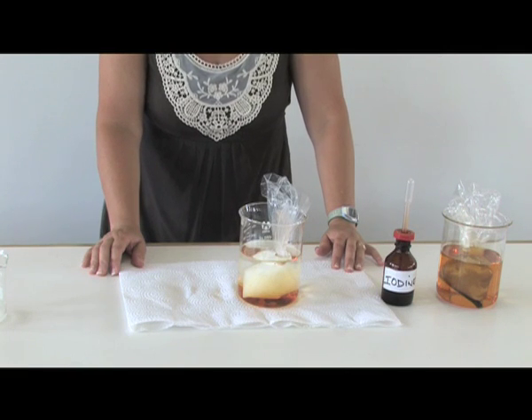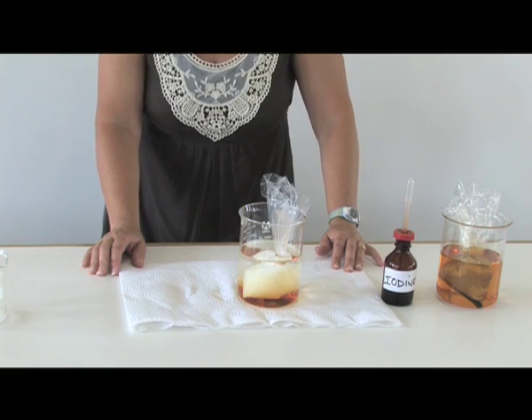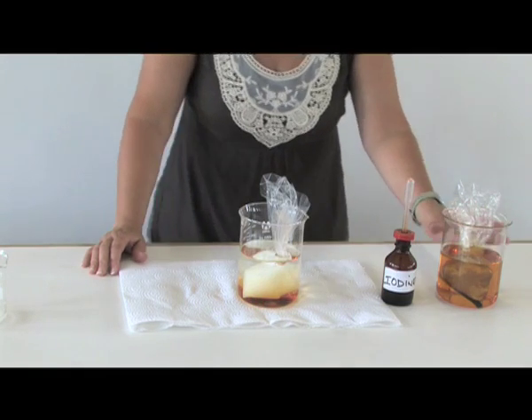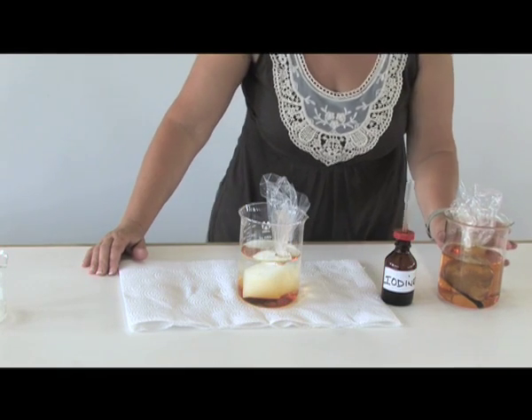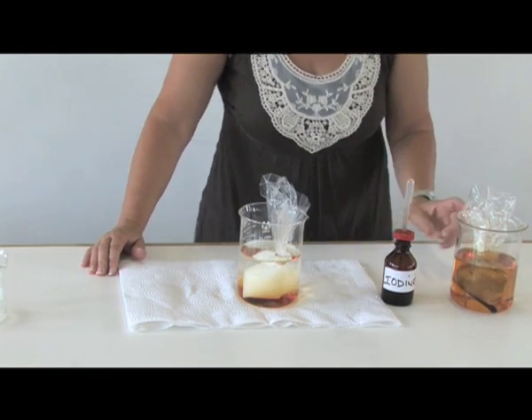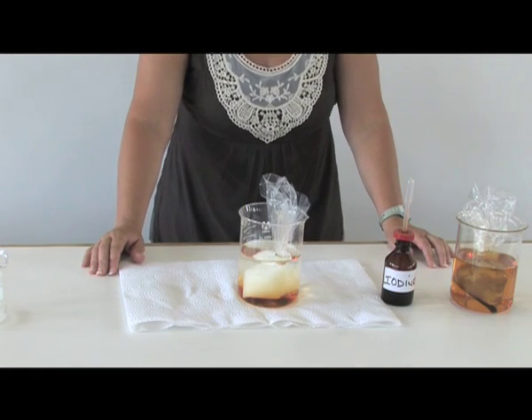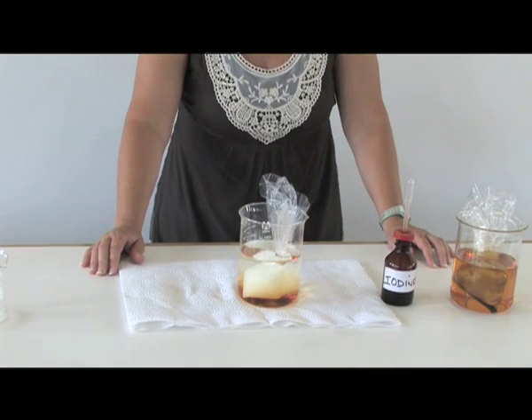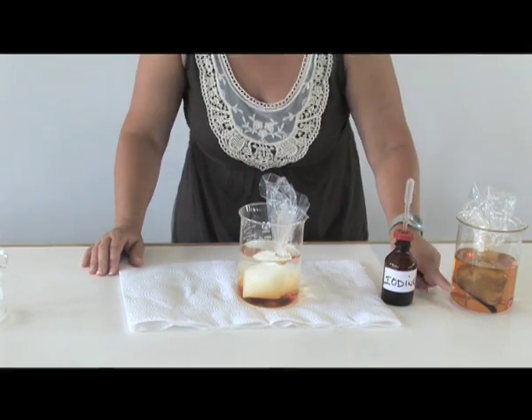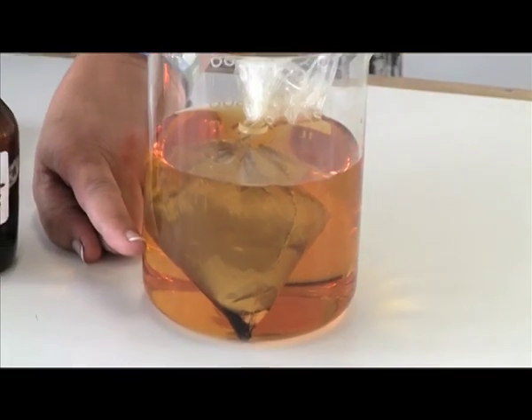Now, how will we know that this has happened? After a while, you will see that the starch solution inside the plastic bag has changed to a blue-black colour.